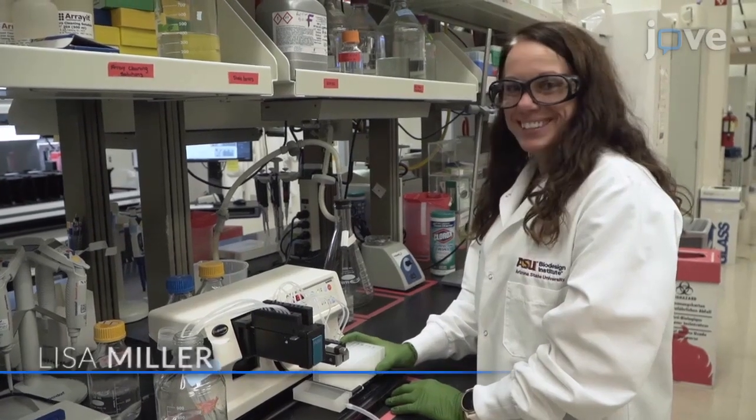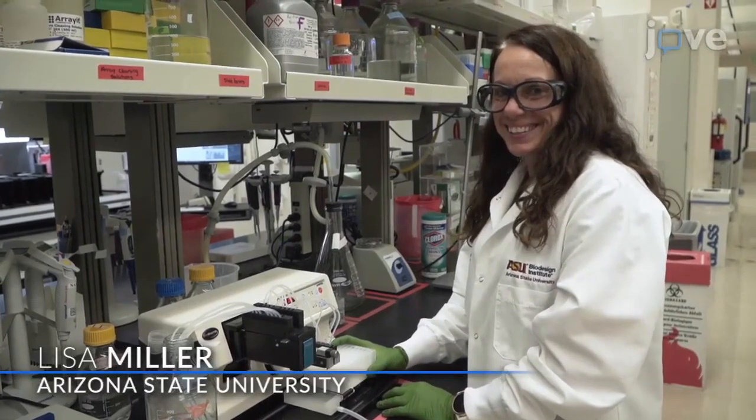Perform quality control steps along the way. Test the quality of your DNA preparation, the DNA microarray, and the protein microarray. If in any step the quality is not good, just start over. Demonstrating the procedure will be Lisa Miller, a technician in my laboratory.